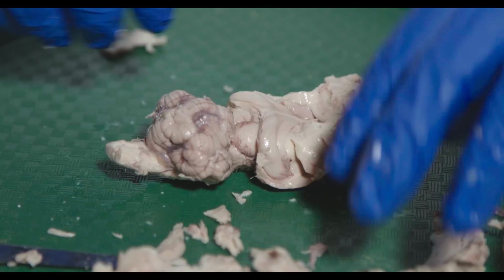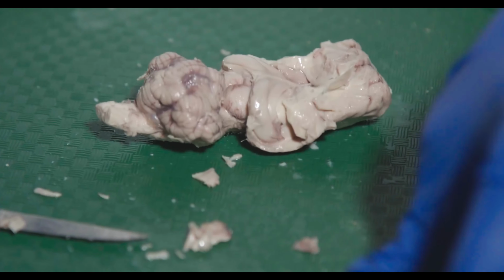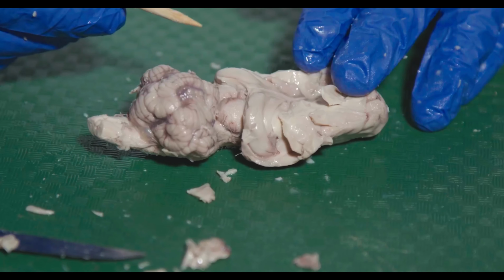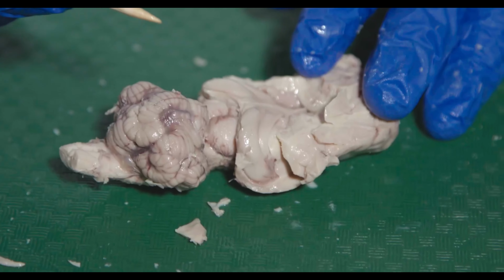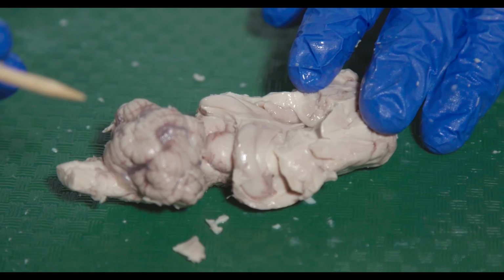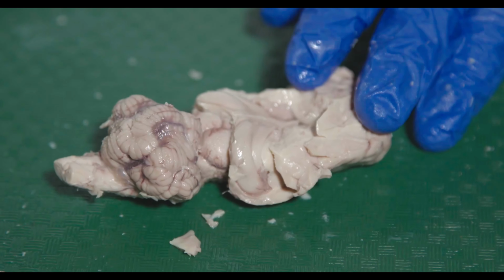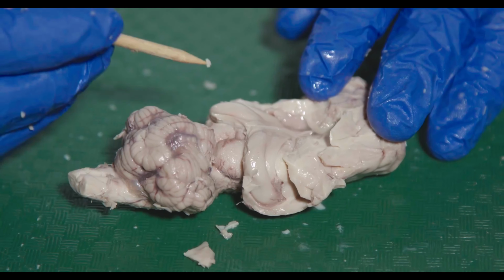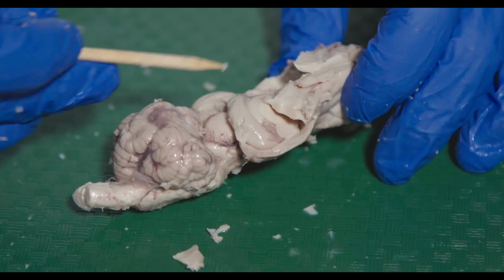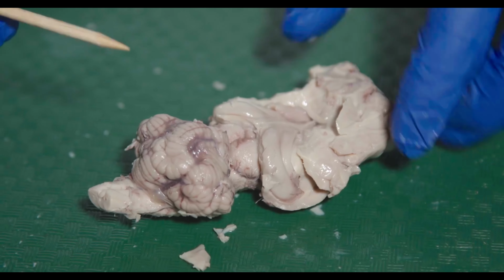So in your lab manual, you'll kind of get to something like this. Sometimes you'll see the name cornu ammonis, or CA. Sometimes you'll see the different hippocampus regions referred to as CA1, CA3, and so forth. That essentially comes from the old name Horn of Amun, the Egyptian god that had a ram's head. So you can see kind of the ram's horns of what the hippocampus looked like, right? It looks kind of like a ram's horn facing this way.